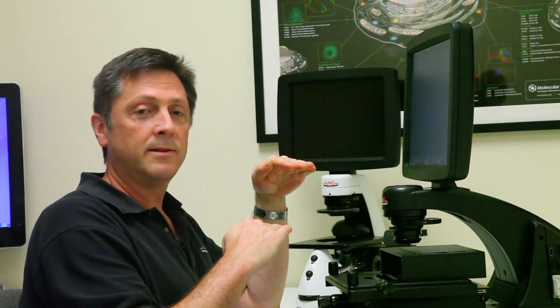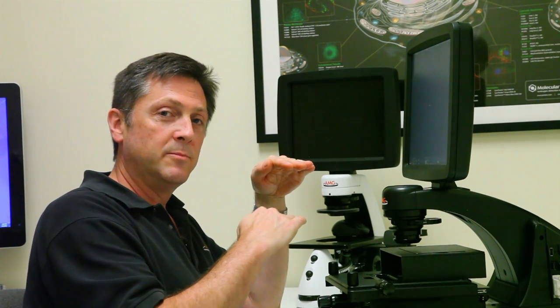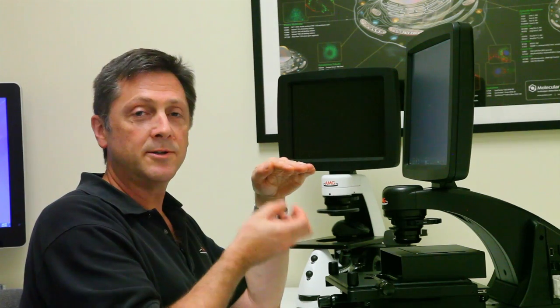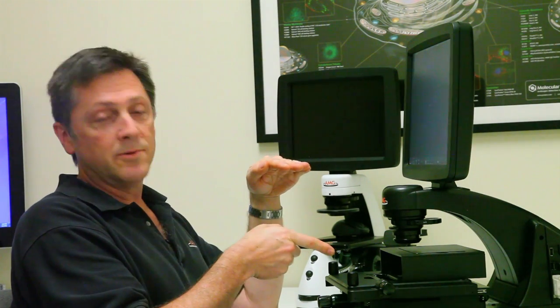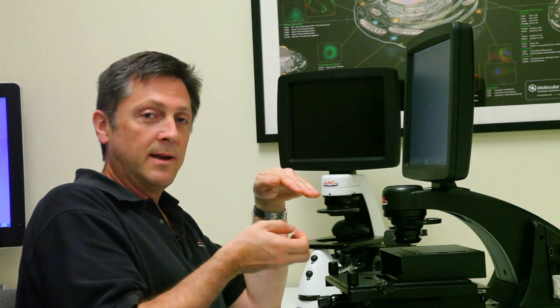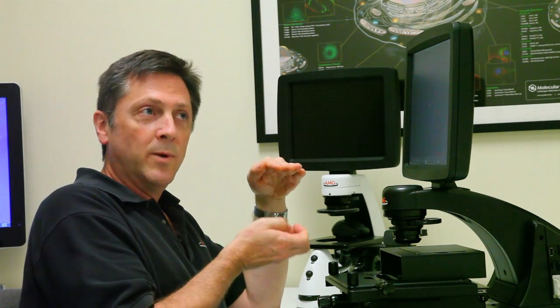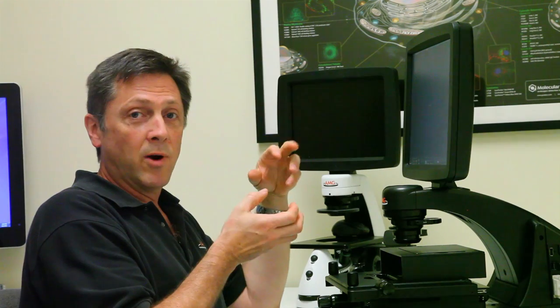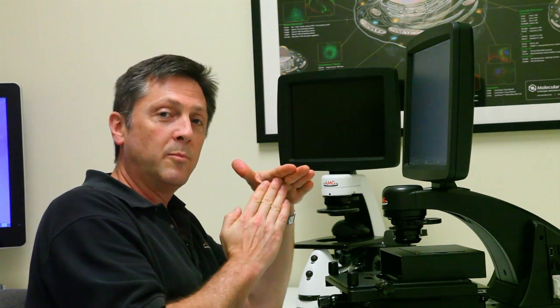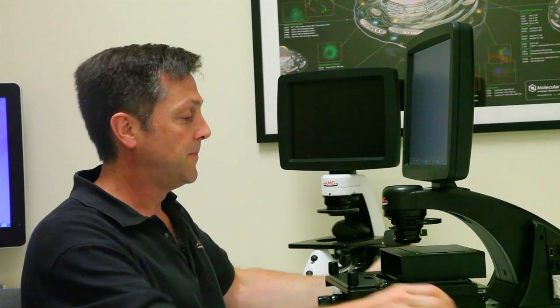What we're going to do is turn on the illumination and bring the objective up in the focal plane until it touches the cover slip. And when it touches that cover slip, as I look through here and watch the excitation light come out of the end of the objective, it'll get very bright at that moment of contact. And that's when I know that my slide is very close to being in the focal plane, and I can move very carefully upward and focus and find my sample.